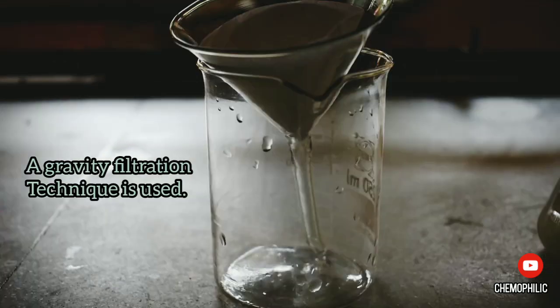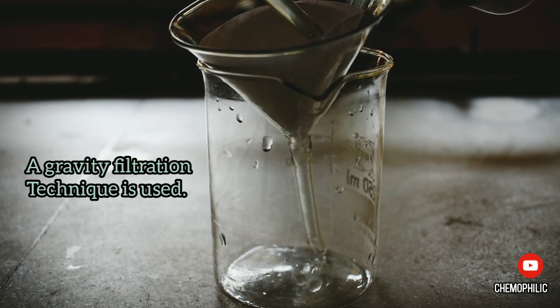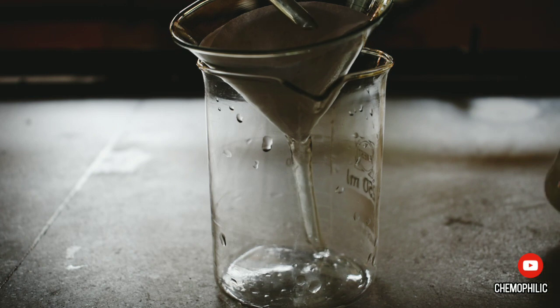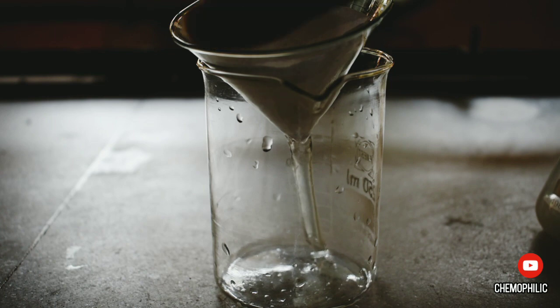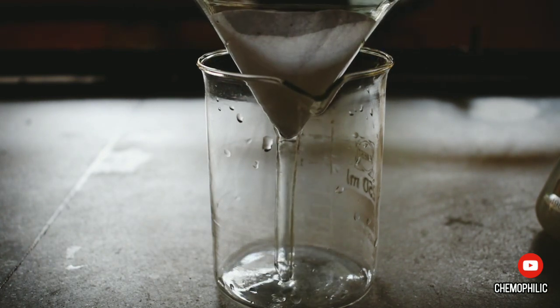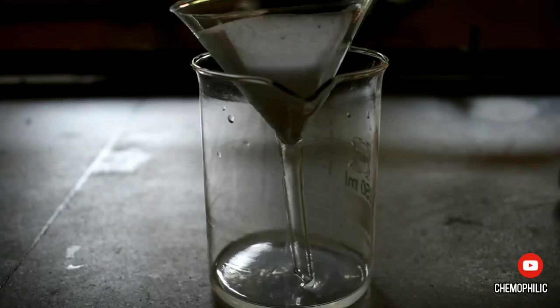I set up a gravity filtration which took me around 20 minutes to get the filtrate. One needs to have patience during gravity filtration because it is a slow process, and hence vacuum filtration can be used as a faster alternative.